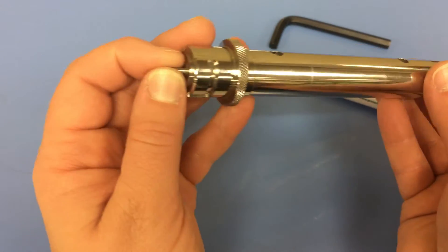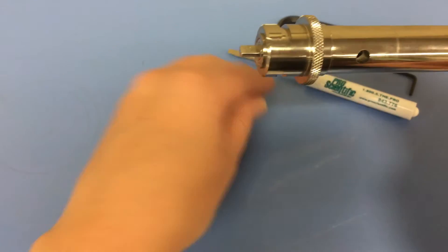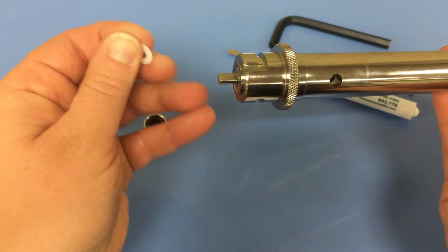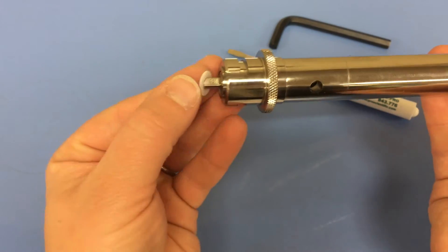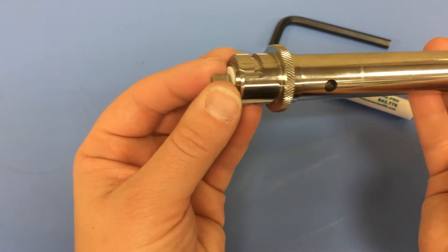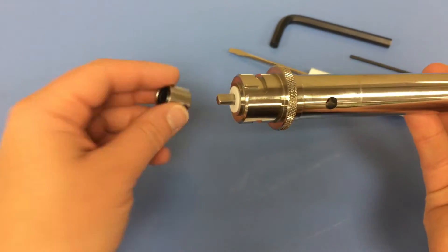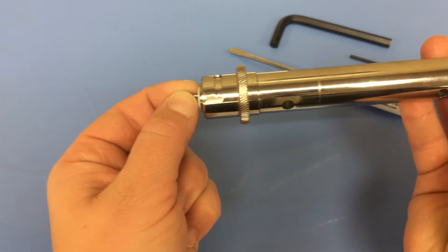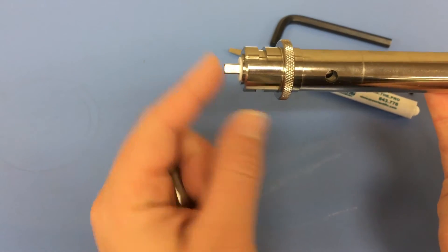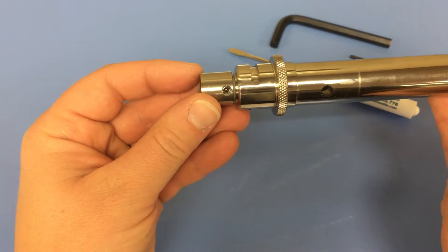While pushing against the rotor knife, place the PTFE washer over the end of the rotor shaft and put the rotor shaft collar assembly onto the rotor shaft. Make note of the flattened portion and align it with the set screw.